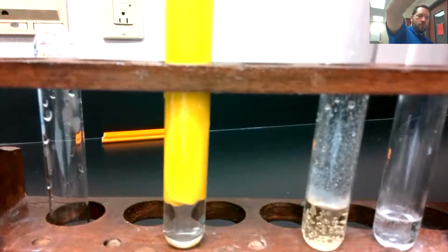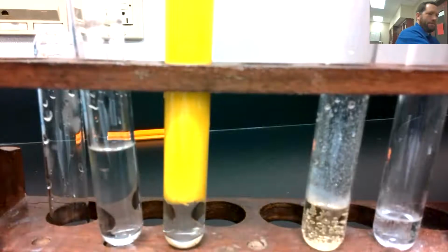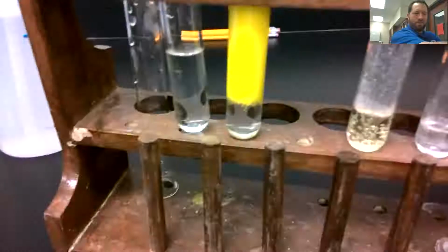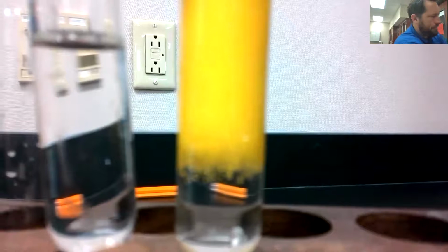Ooh. Well, that was interesting. Did the camera catch that? Zoom out a little bit. You've seen the whole reaction there. That was pretty cool. I've actually never seen it before where it freezes up like that at the bottom. I'm not sure exactly what happened. I think that's awesome. Great documentation here.